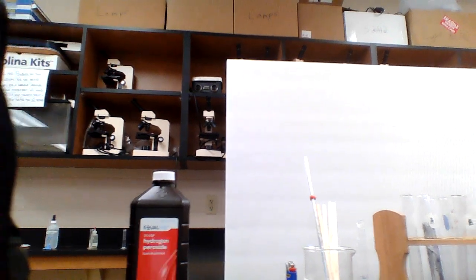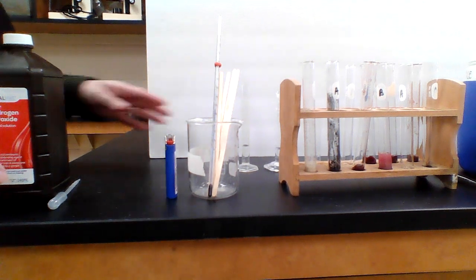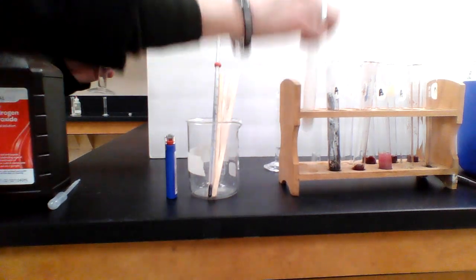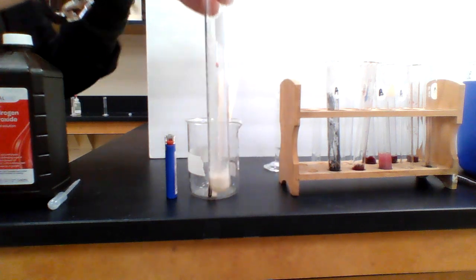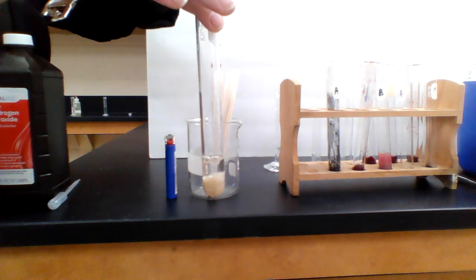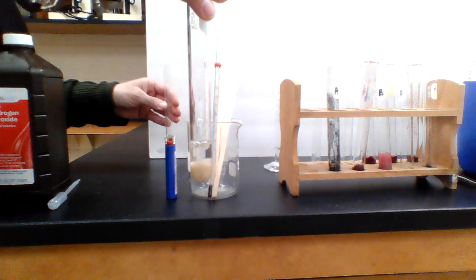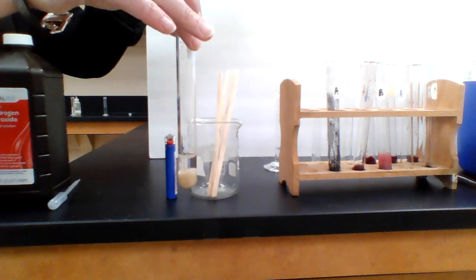We're going to do the very first one, and the first one is a control group. I'm going to lean my camera forward a little bit more. I'm not expecting really exciting results with this one. So this is just sand in the bottom. Sand is neither a catalyst nor does it have an enzyme in it. I'm going to pour into it the hydrogen peroxide, and I'm going to observe it to see if there's any bubbling. I'm also going to take a temperature.